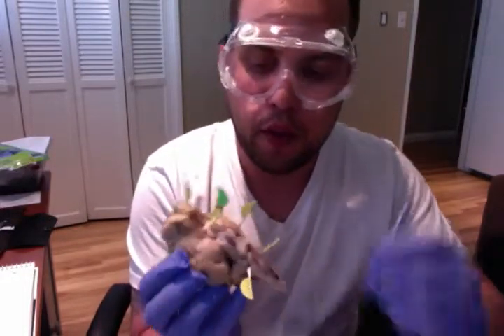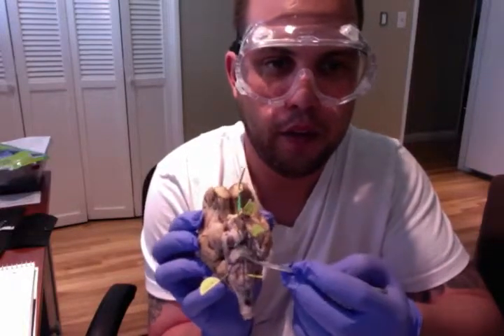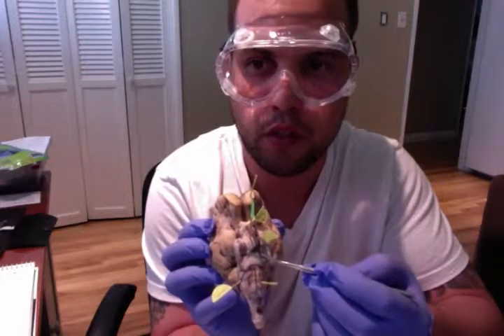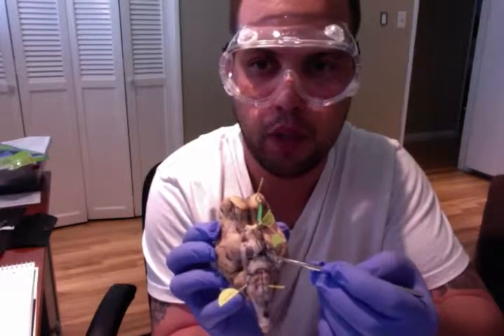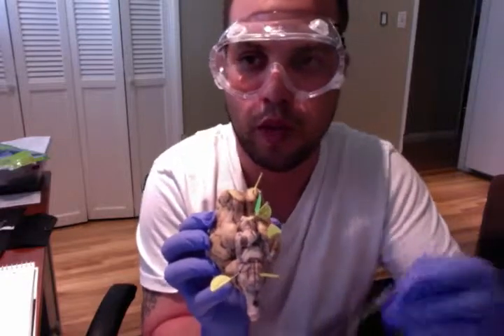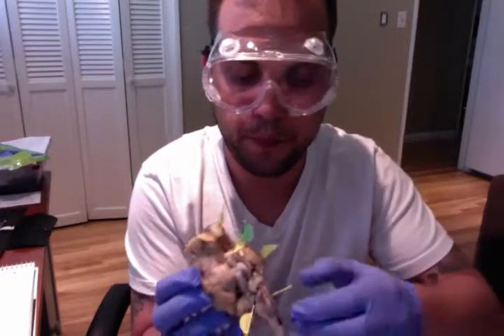Before I go on, I wanted to describe the pons as well. The pons, again, right here, its function is to relay messages from the cortex to the cerebellum. Without the pons, the brainstem would not be able to function because messages would not be able to be transmitted.